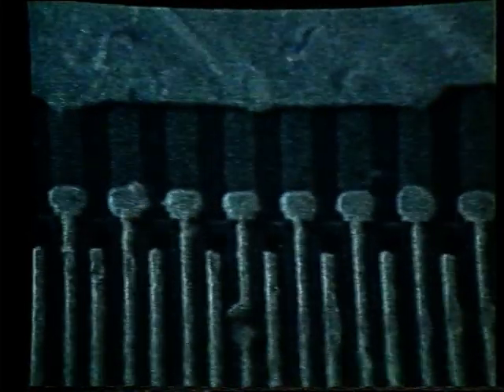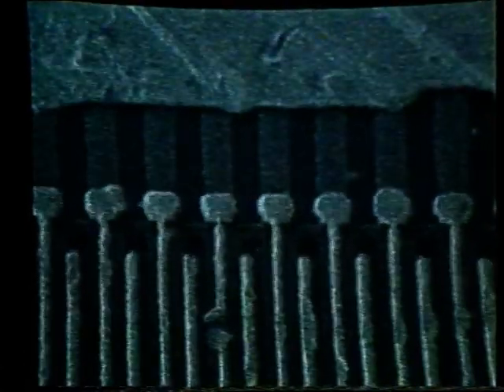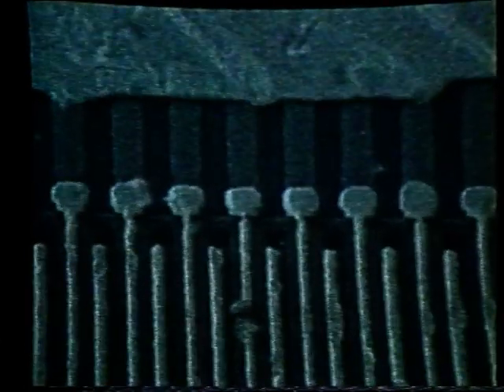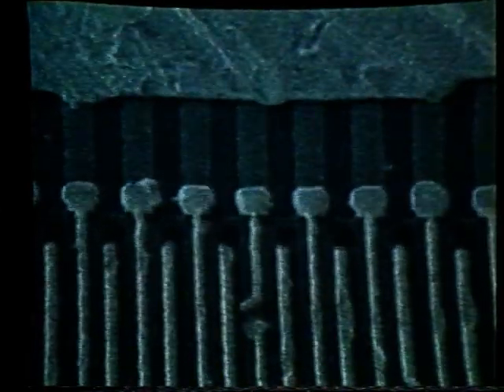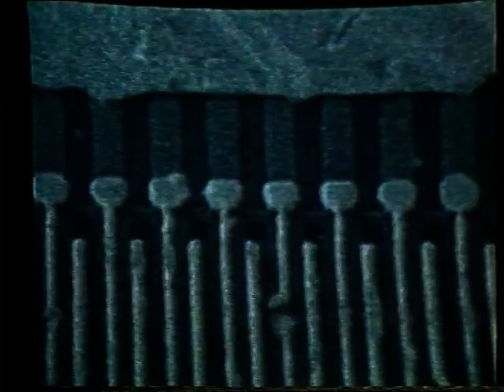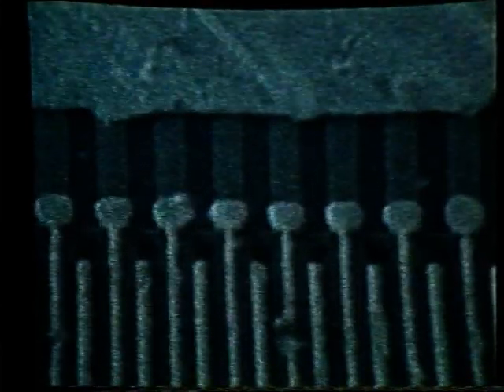Maybe a little bit of movement in the X direction, so let's use the left-right arrows. Worse in that direction, so we will now use the opposite arrow. Again, we now see more of an up and down movement, so once again using the up-down arrows.